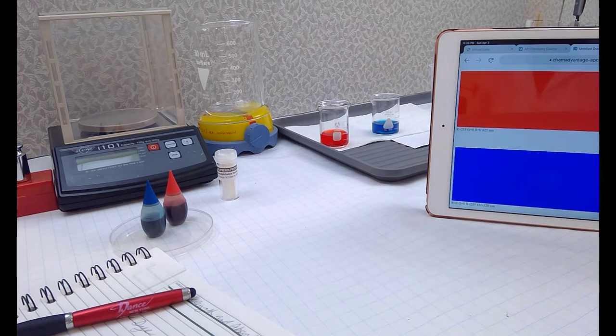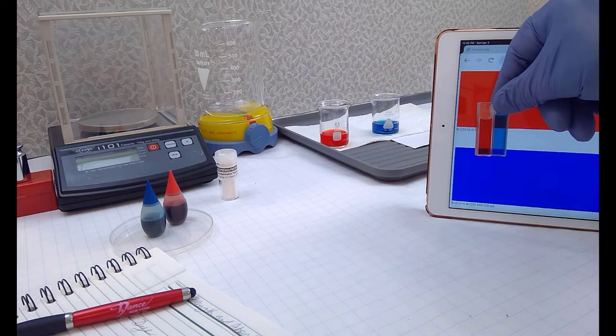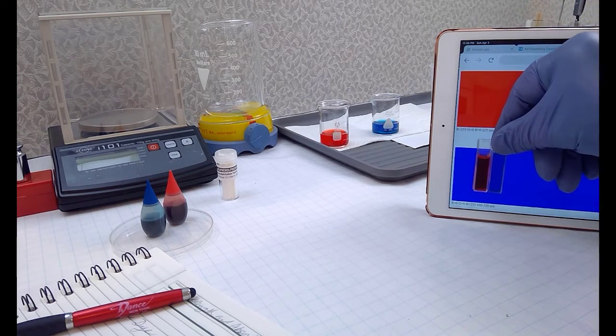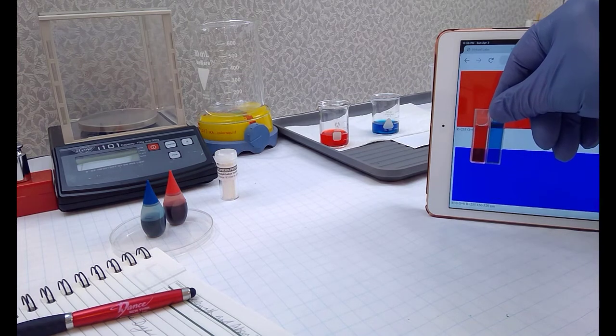We're going to look at these solutions, the red and blue solution, in front of these red and blue screens that we have with just those wavelengths. Note, when we've got the white background, you can see the red and blue very nicely. But if I move this up to here, all of a sudden my blue becomes much darker, but my red isn't diminished at all. Down here we get exactly the opposite. The red turns almost a black, and our blue keeps its intensity.